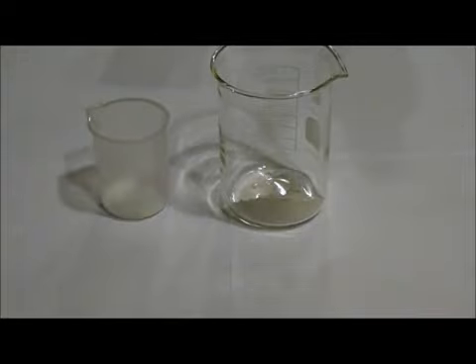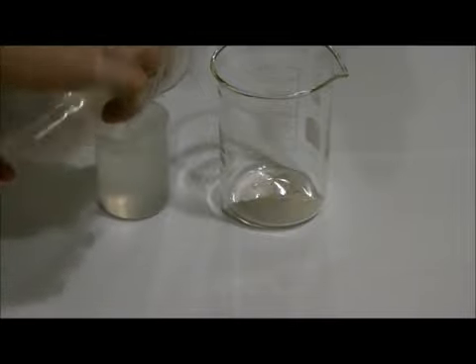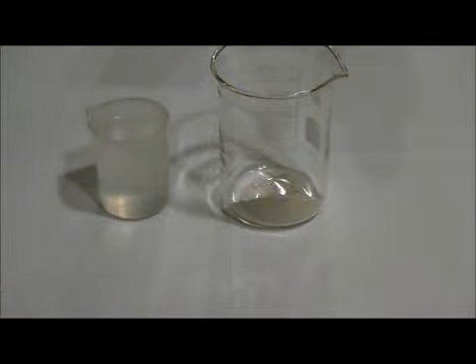To start, we'll add 100 milliliters of hot water to the oxalic acid to fully dissolve it, and 200 milliliters of hot water to the iron sulfate. As you can see, it turns a fairly dark reddish brown colour.